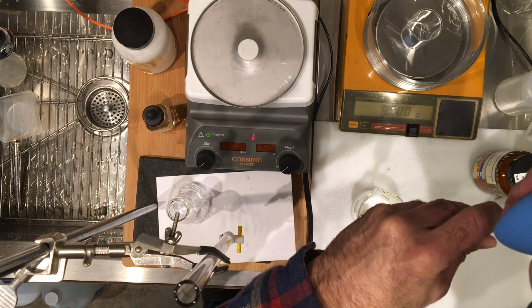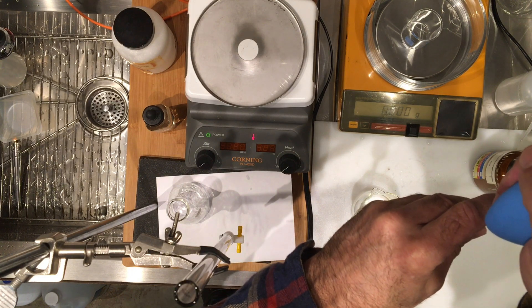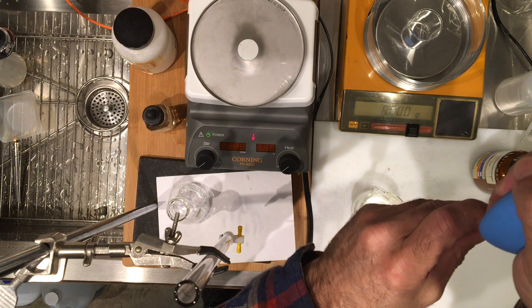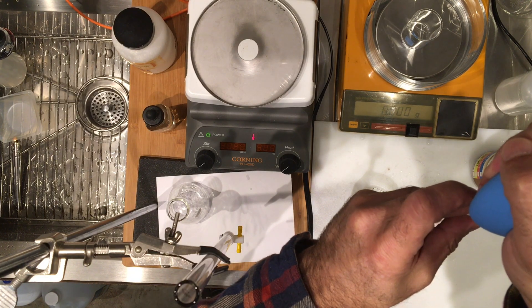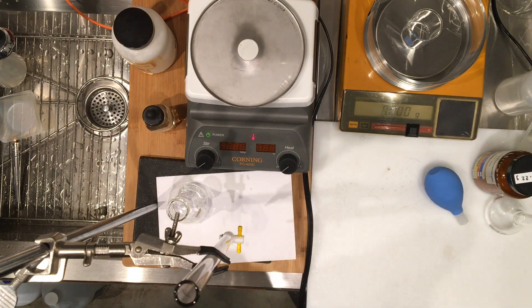And then we're going to work with this volume, because we have to go through a dilution process to make sure that the titration is still within 20 or so milliliter of volume, because that's the space that I have.